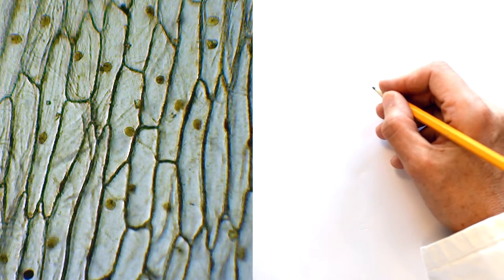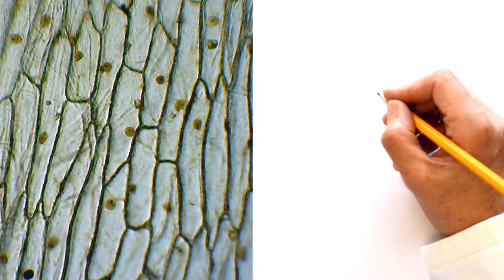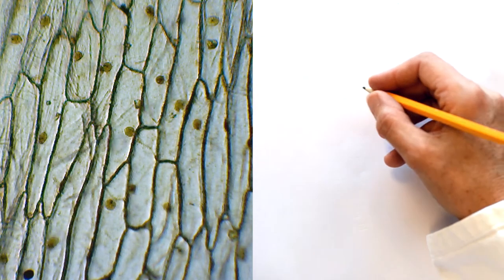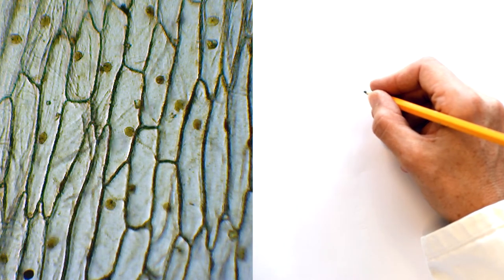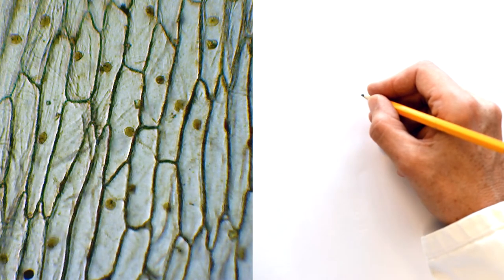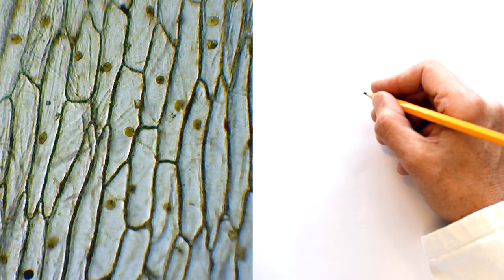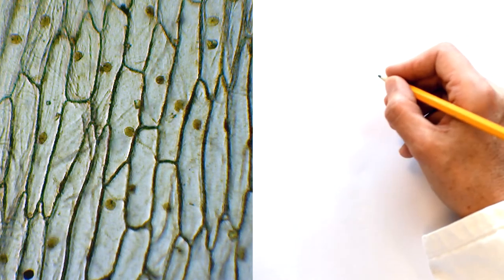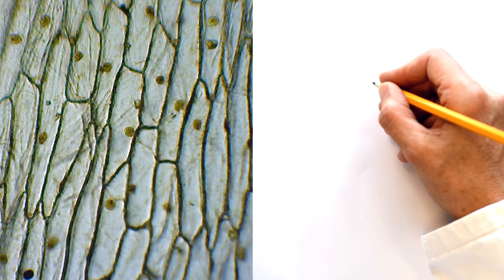So in the centre as I look down now I can see a central cell which is the one I'm going to start with and I can see how it interacts with the other cells. So the first thing I'm going to do is I'm going to draw that centre cell. Now I was actually taught as a student myself not to look up but that's a little bit tricky really. So I'll keep looking up and looking at my paper to keep checking that I'm doing the right things.